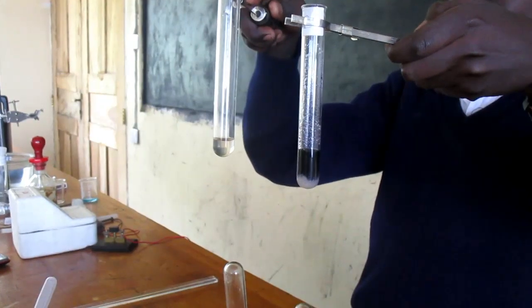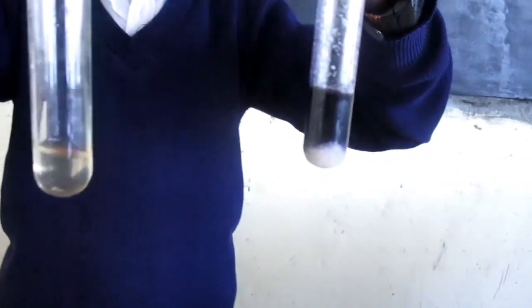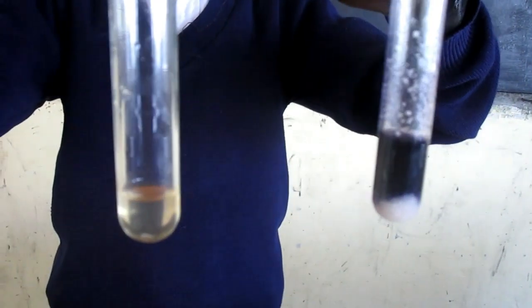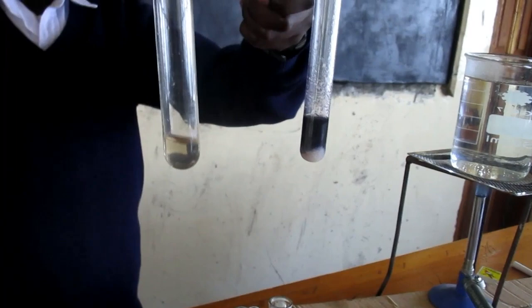If the color changes into dark blue, it means the food sample contains starch. As we can see, food sample B contains the dark blue color and food sample C does not. This means food sample B has the presence of starch.